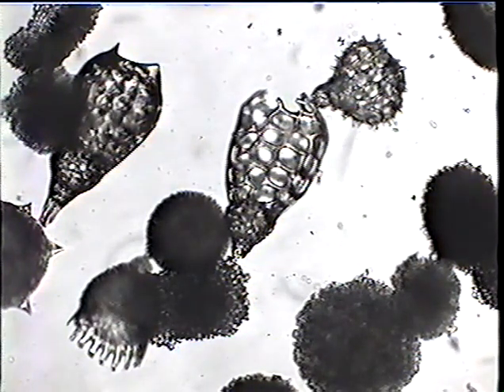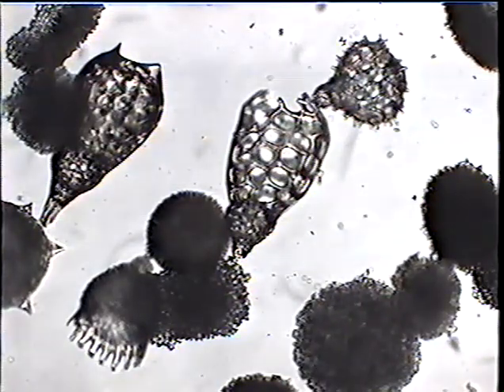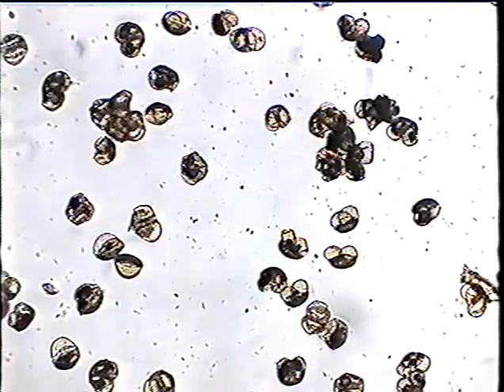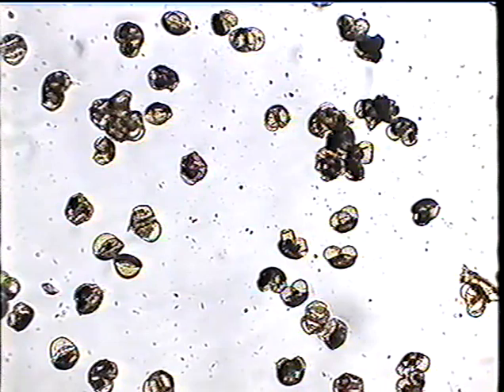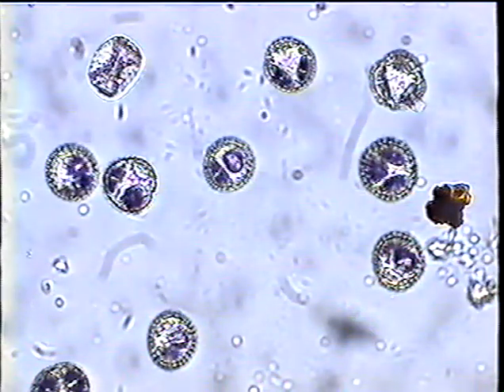The microscope simply magnifies objects too small for us to see to a larger recognizable size, like these radiolarians, silica, SiO2, little marine protozoa. This is a pollen grain, pine pollen. You might be able to see, if you look carefully, why we call it the Mickey Mouse pollen. All pollen grains are different in size, shape, color, and we can identify the species of the plant just by recognizing these particles of pollen.